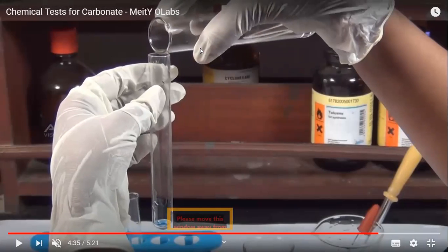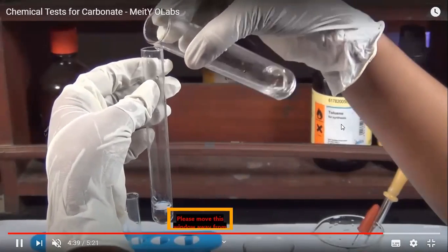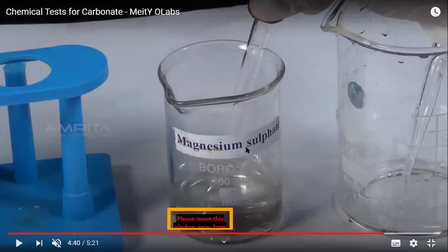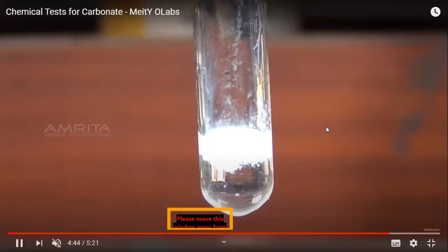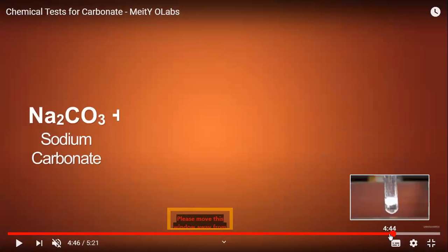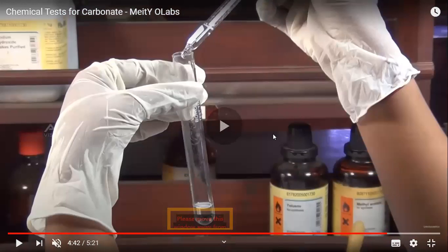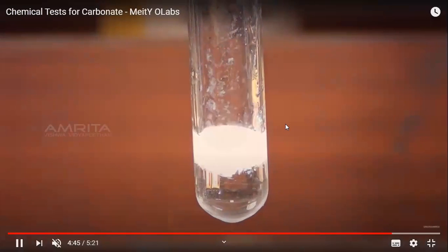We'll take the salt solution into a test tube, my dear students. In this solution, we are going to add the magnesium sulfate solution drop by drop. You can see as soon as we add the magnesium sulfate solution, what do you observe, my dear students?